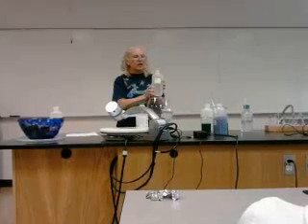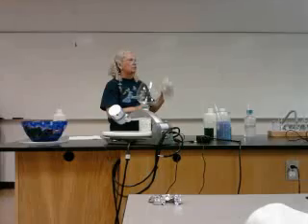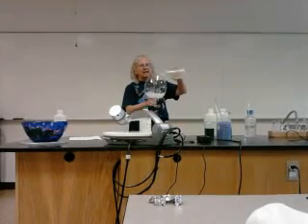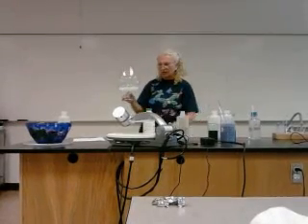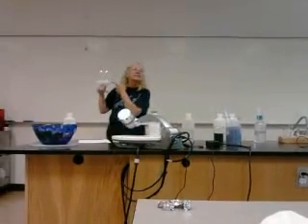Okay, well, we have calcium chloride, which is a soluble salt because most chlorides are soluble. And we have sodium carbonate, and almost all sodium salts are soluble. But what happens when we mix these 2 together? We create kidney stones that we hope we never have to have. Insoluble solids, so what happened? A precipitate, a solid, was formed. These are the 3 visual ways that a chemical reaction occurs.